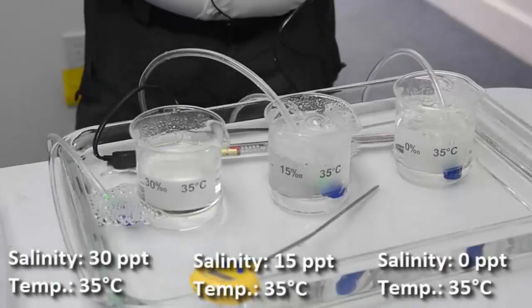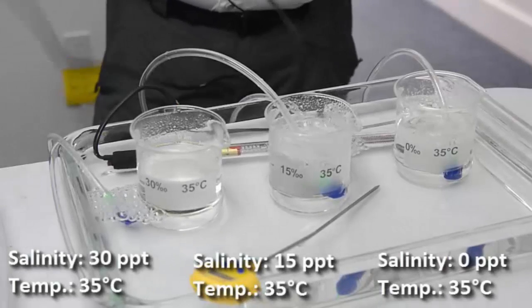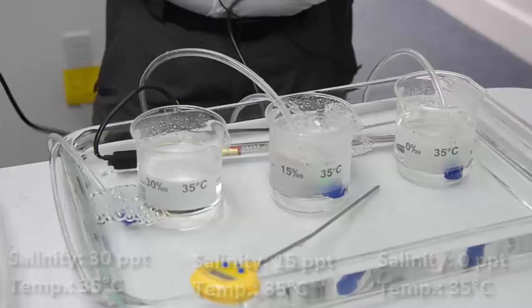Over here we have an aquarium heater and it is now at 35 degrees centigrade, so much warmer, and within each water bath we have three different beakers that are being aerated and they represent three different salinities.